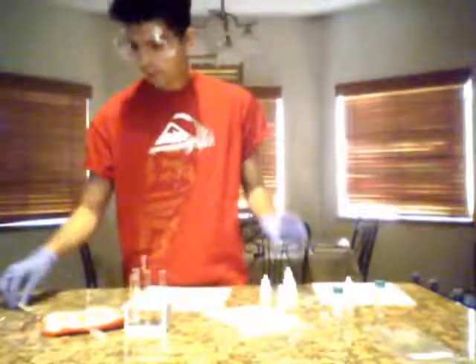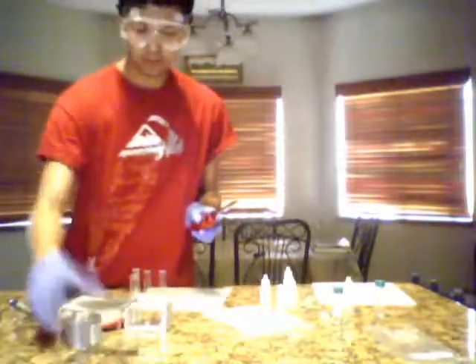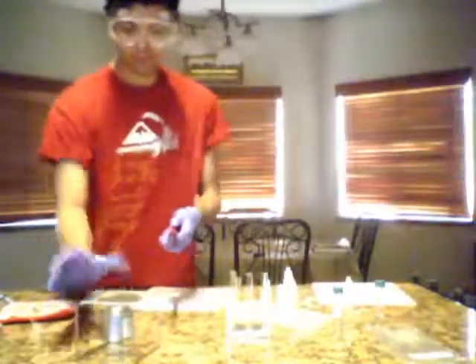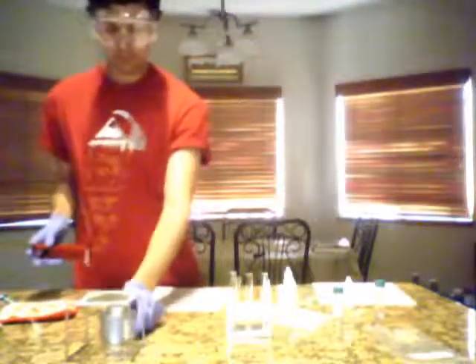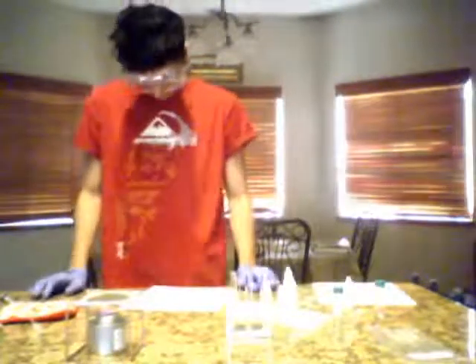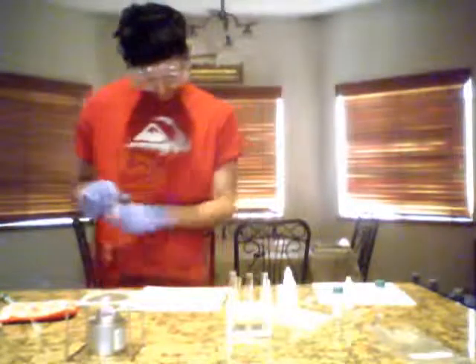So just like before, we're going to set up our burner. And we're going to bring our water to a boil too, just like before.